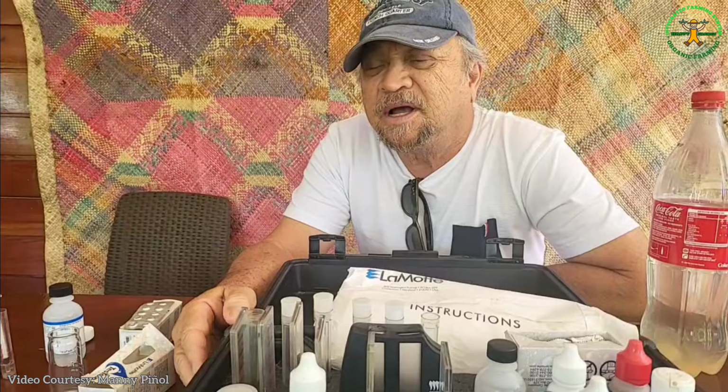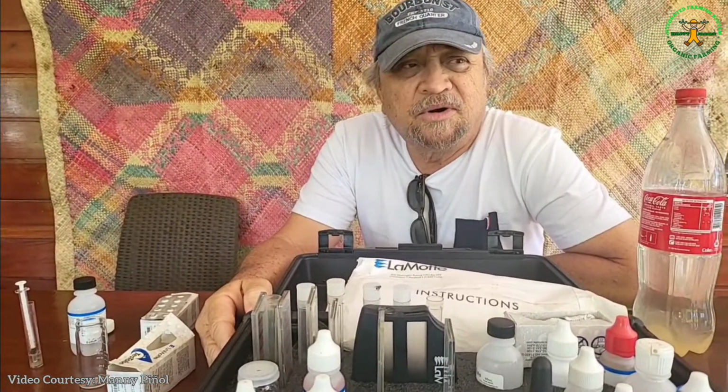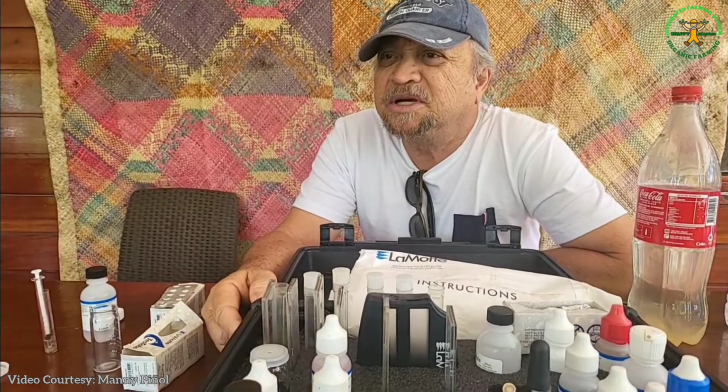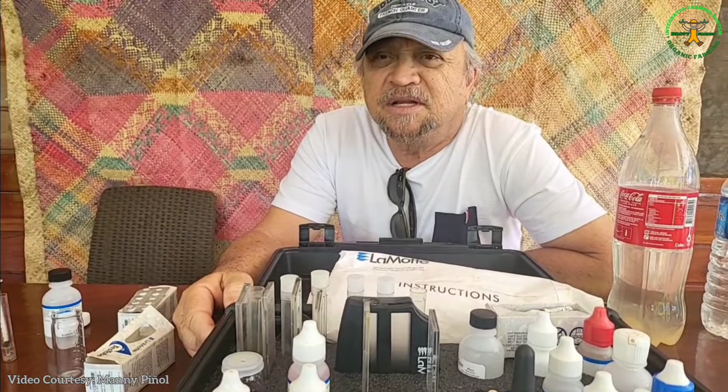It's a very simple, basic test. You get a water sample, about 5 ml, and then you put in some chemicals and you titrate other types of chemicals, and once the color is attained, you read how much of these chemicals you titrated, and you have it there.